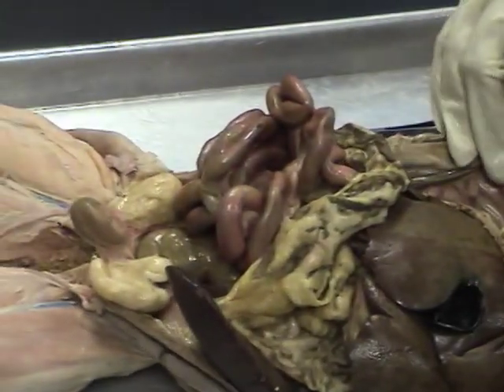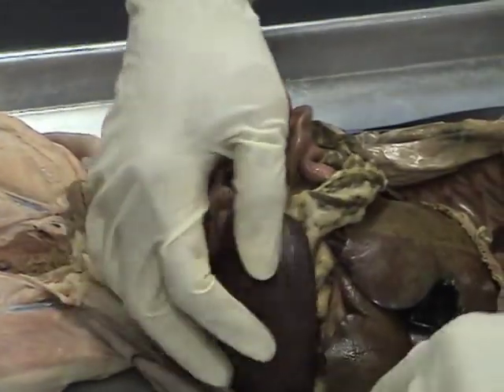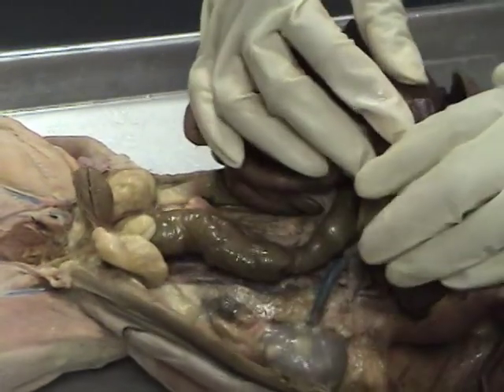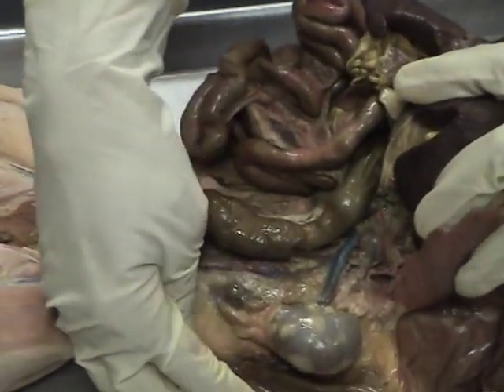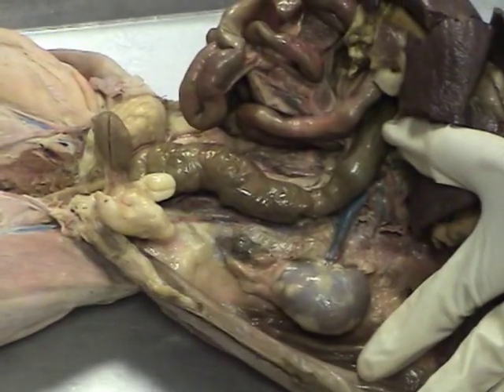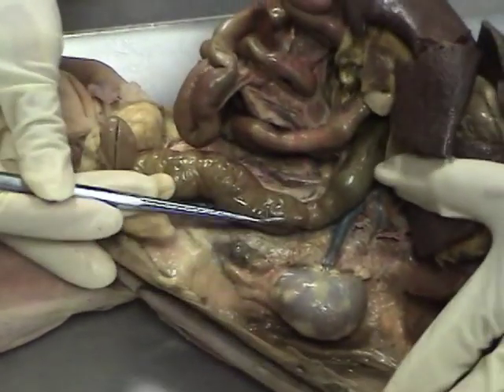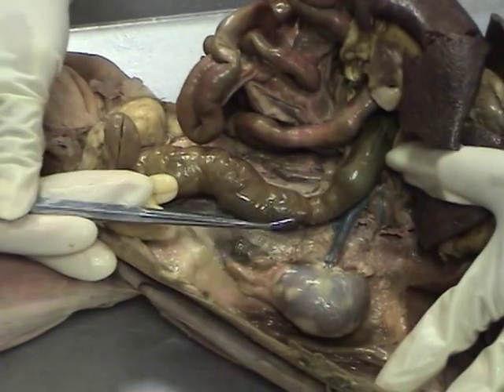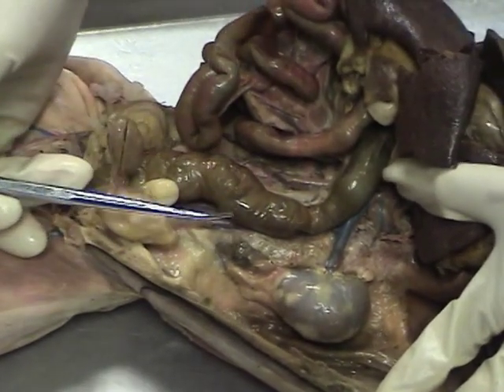To see the urinary structure, we're going to have to remove and push aside the abdominal organs. Behind this, you normally see a membrane called the peritoneum. The kidneys will be retroperitoneal, so they're behind this peritoneum.